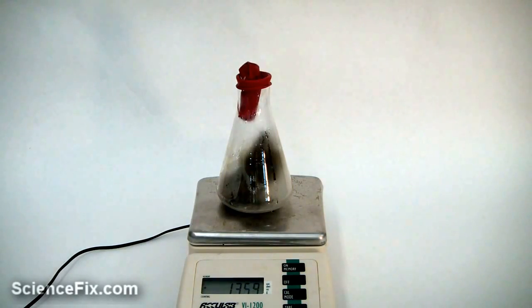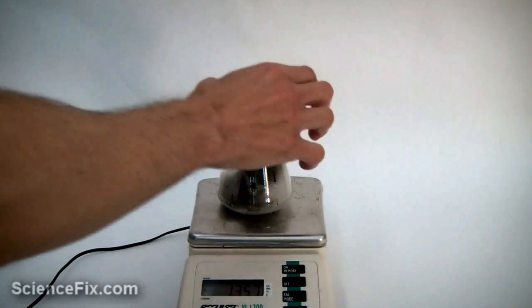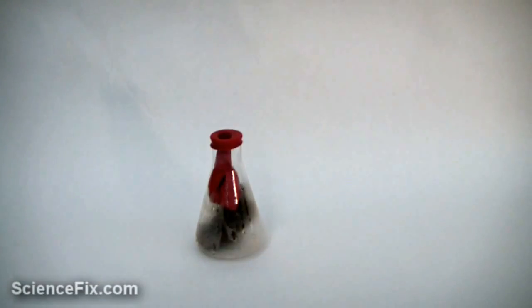Again, notice the mass of the flask, steel wool, and balloon system. The overall mass of the system hasn't really changed. This demonstrates the law of conservation of mass or matter.